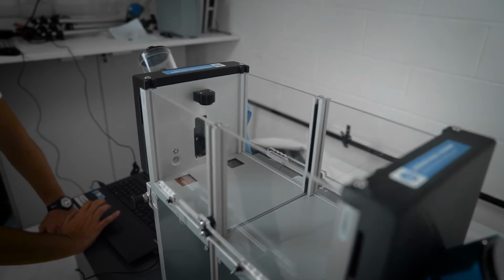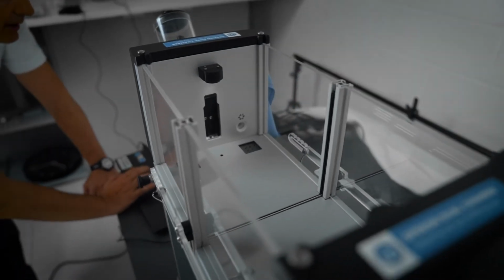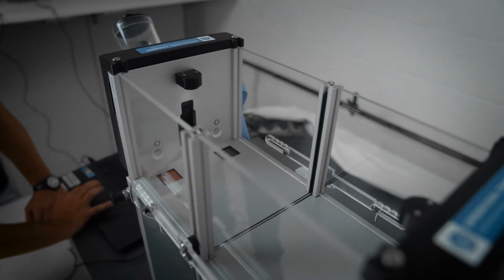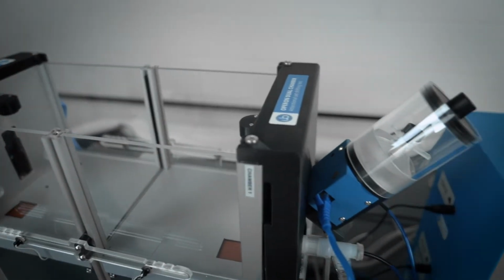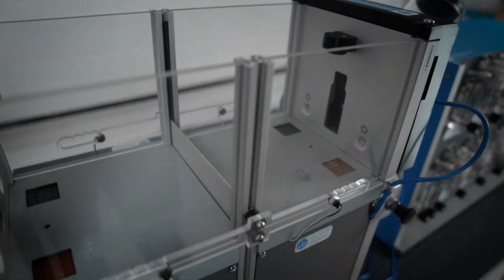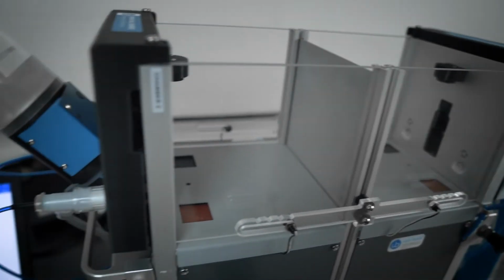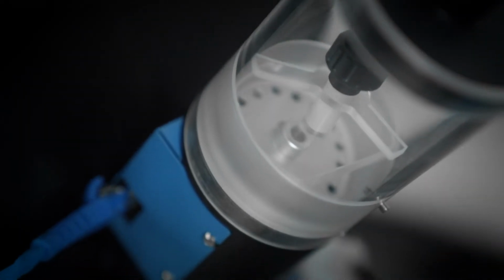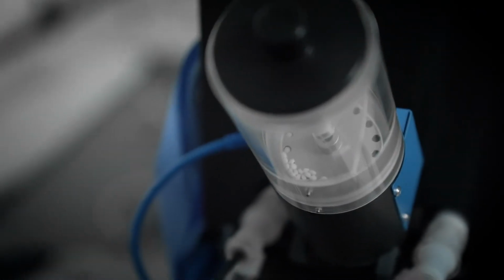As you can see, it is very smooth, and obviously you can also hear this click, which is the switching on of the different odors. If we go into the pellet dispensers, which are also special Ugo Basile pellet dispensers, you can see how they operate. We have this pellet dispenser in which we can deliver a pellet.